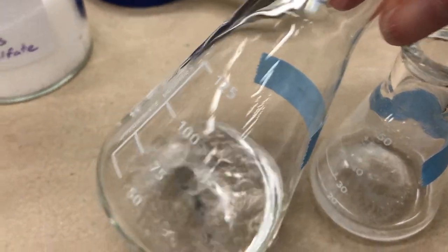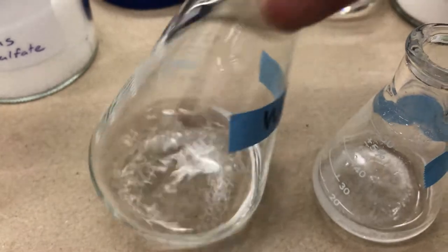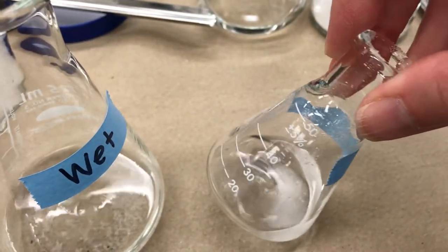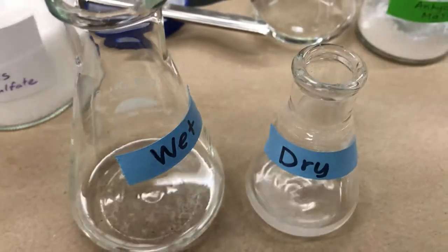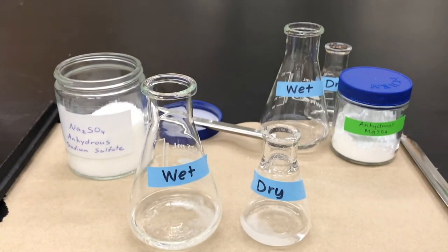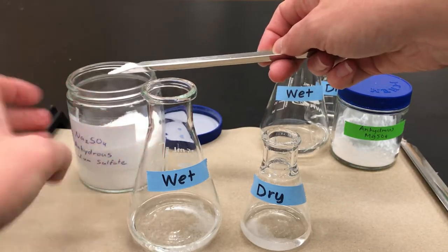Can you see that the clumpiness has stuck to the glass? That's also something that happens with the hydrate. When it's free-flowing, it's not hydrated. So the things you're looking for are small particles — if all of it is clumped, you want to add another portion.